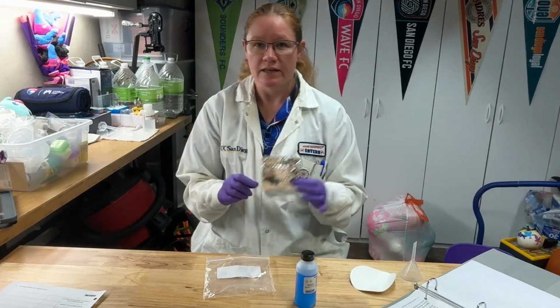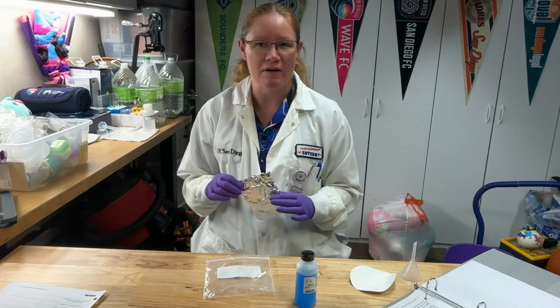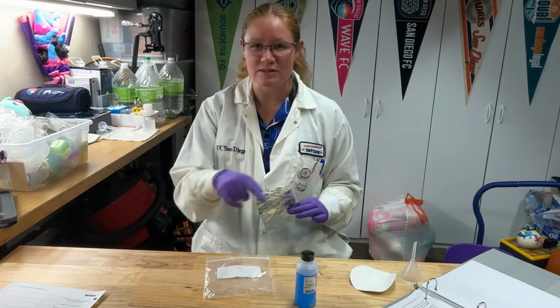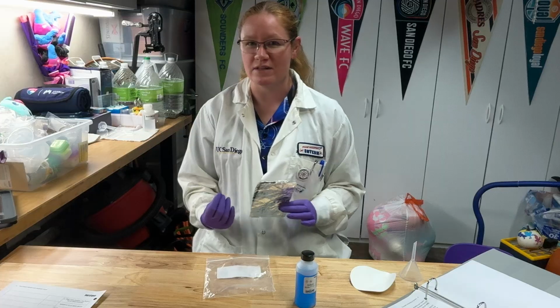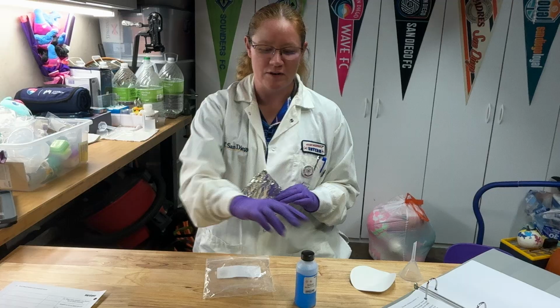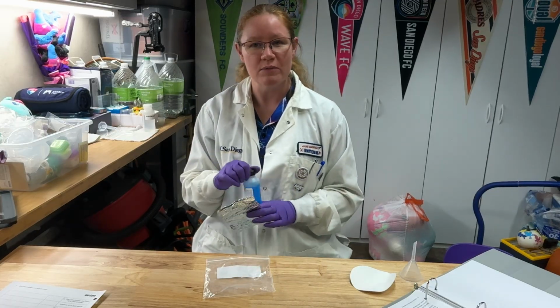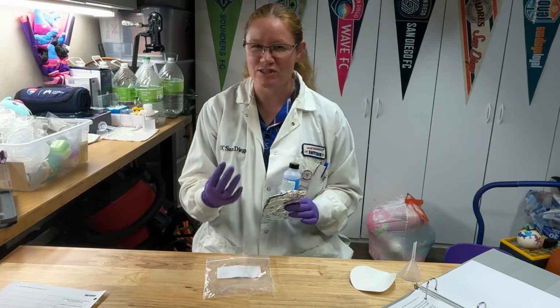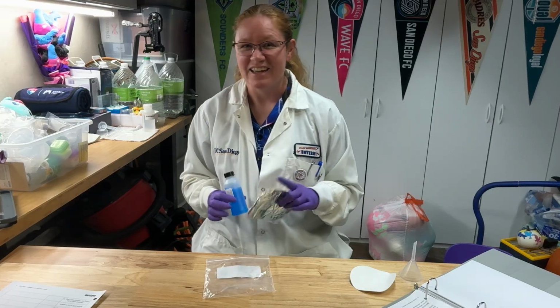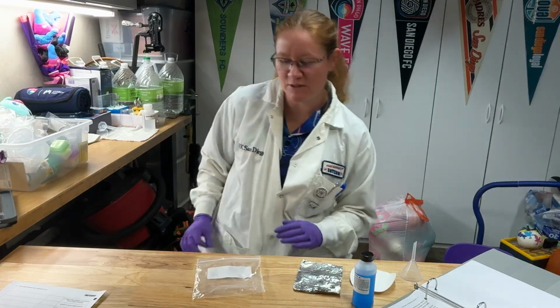During this reaction, you'll be adding some aluminum foil to your copper 2 sulfate solution. Aluminum and copper undergo a single replacement reaction. Aluminum is more active than copper. So when placed into a solution that has copper ions, the aluminum wants to dissolve and become an ion, and then the copper will precipitate out. One of the ways you will know your reaction is occurring is not just the formation of the product or maybe some gas evolving, but the blue color of the solution will gradually disappear as well. All right, so you'll have those ready.